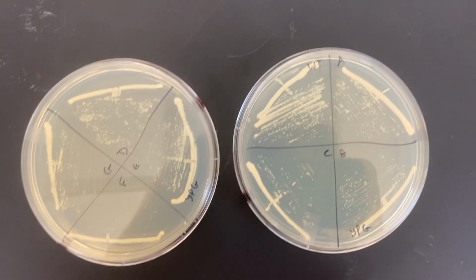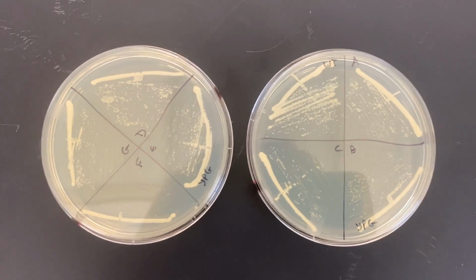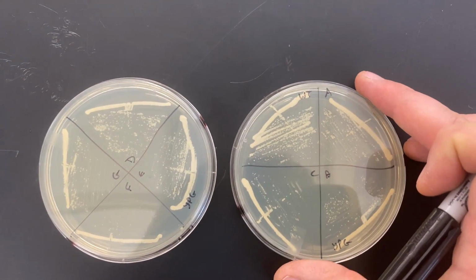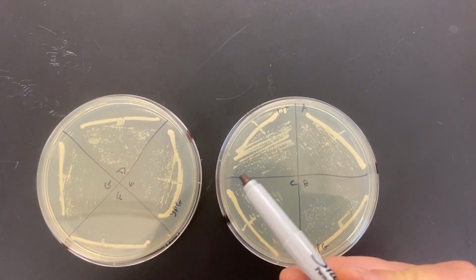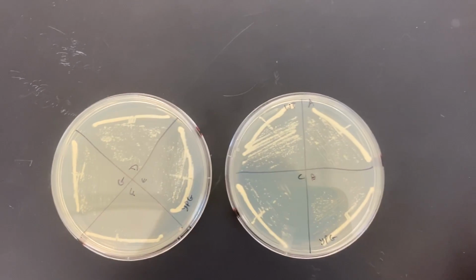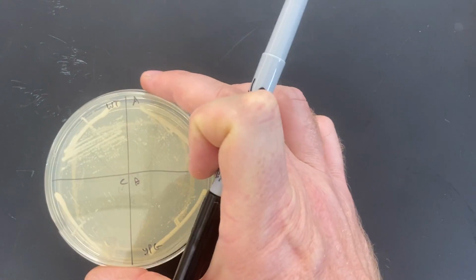As with a lot of things we do in introductory labs like this, this is giving you a flavor for what you would look for. If you were in a research lab and you were really interested in isolating these aerobic respiration mutants, you would certainly do more testing after this point. But at first blush, we might have wild type compared to F, wild type compared to G, maybe a little bit of a difference there. We could run subsequent tests, and certainly replication would help us to confirm that they grew differently.